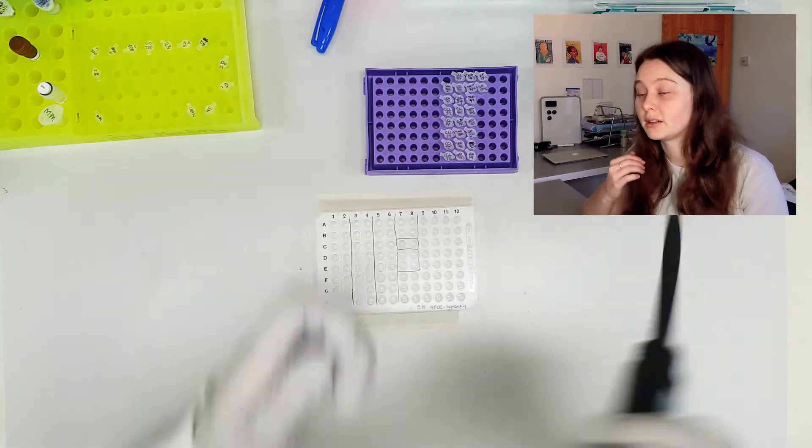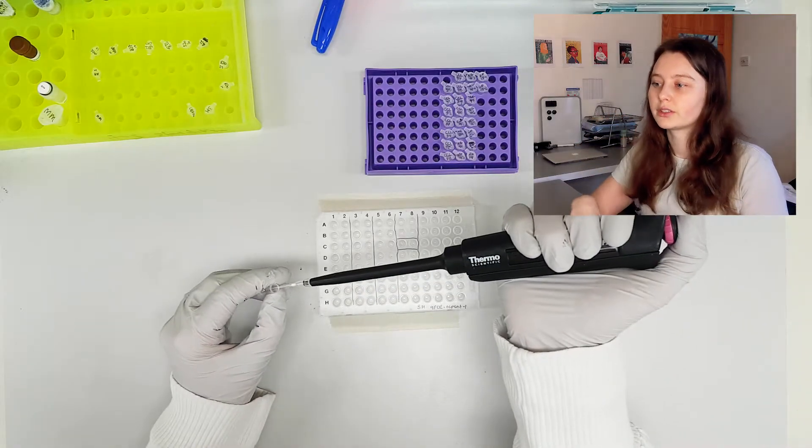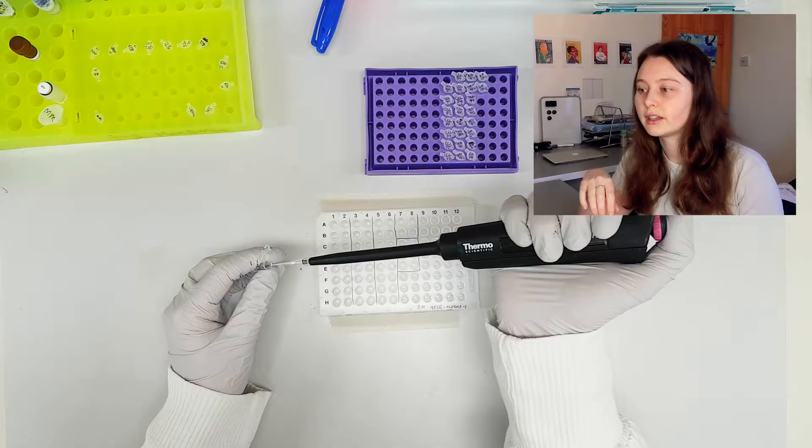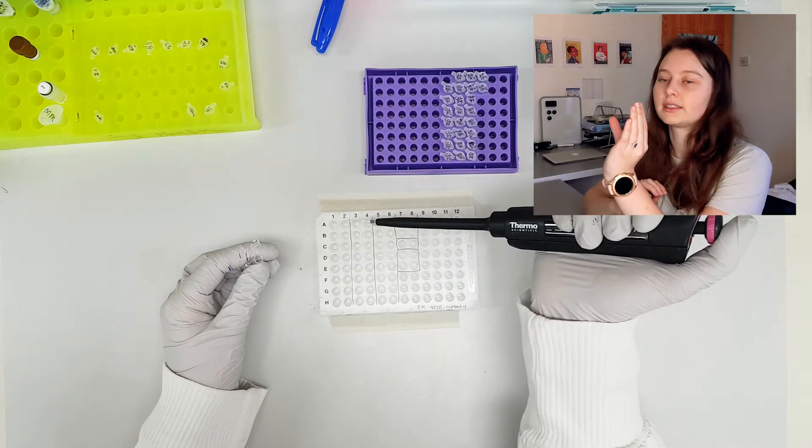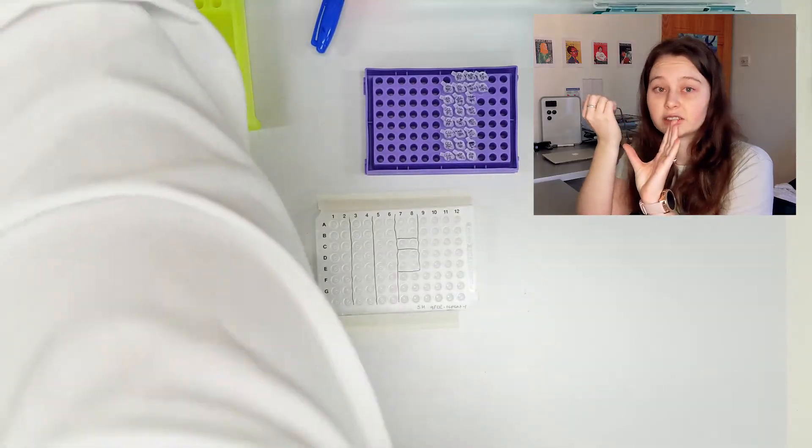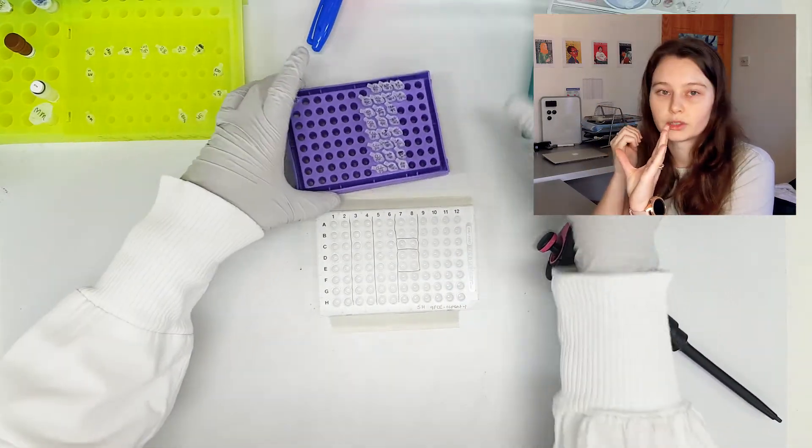So now it's time to put the sample in. You want to be really careful with the sample, it's quite a small volume. So with the master mix I wasn't too fussed, I can very easily visually see where it's going. But now that there's already liquid inside that well, I need to be careful not to fail to expel the liquid, or I just want to be double sure that I've pushed out this small amount of liquid.